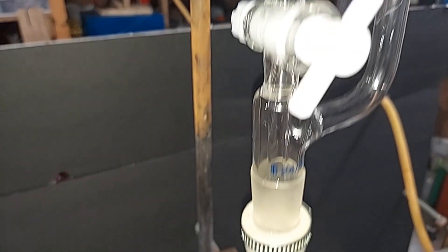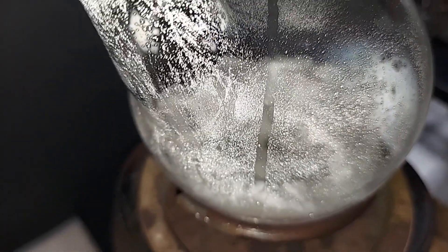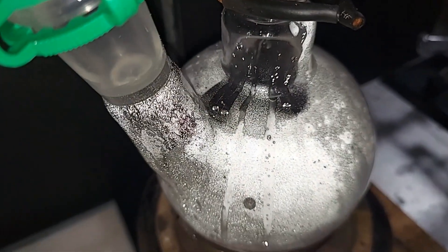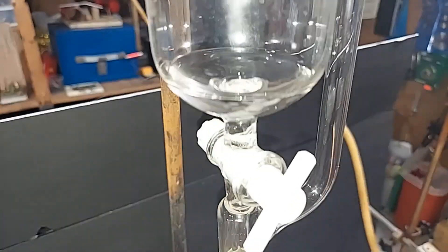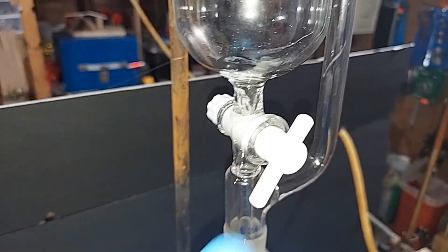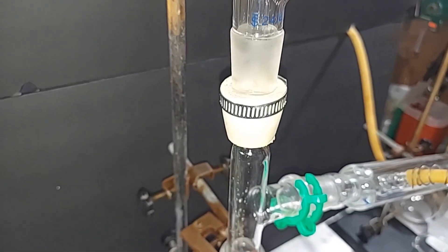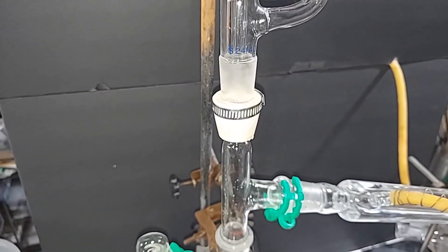Over half of the sulfuric acid has dripped in after about 15 minutes. There's a dark area in the middle — it soaked from the bottom up but is reacting. There are about 15–20 mL remaining. All of the sulfuric acid has now been added, so I'm closing the valve. I'll swap the addition funnel for the thermometer off-camera, then when we come back the thermometer will be in place.